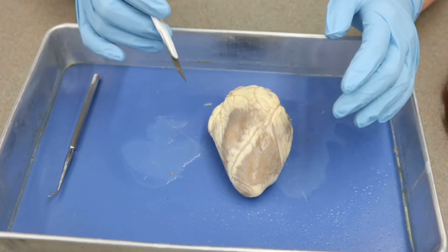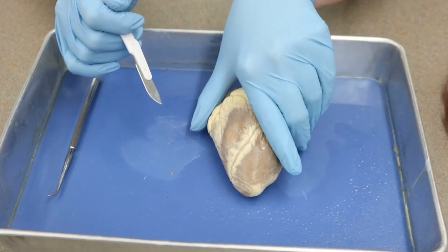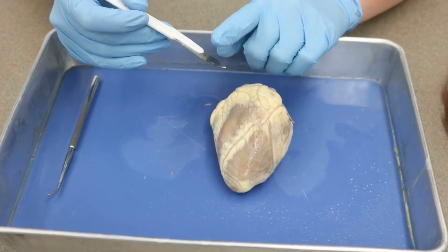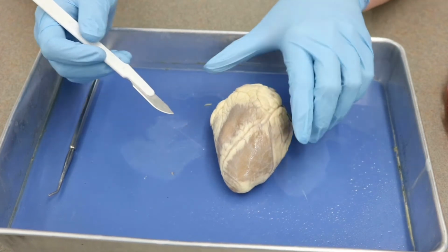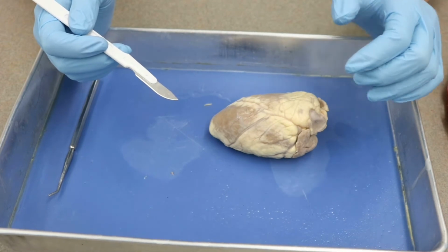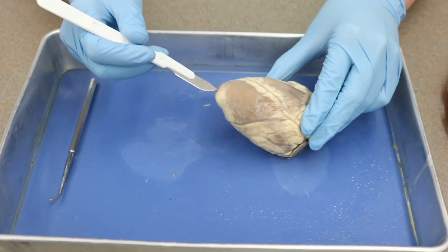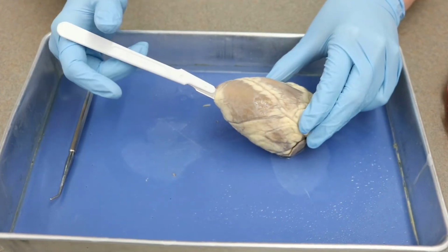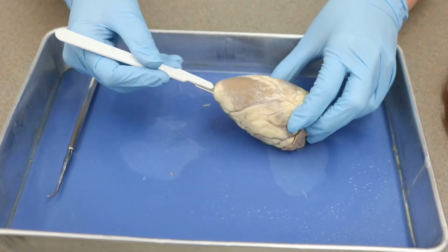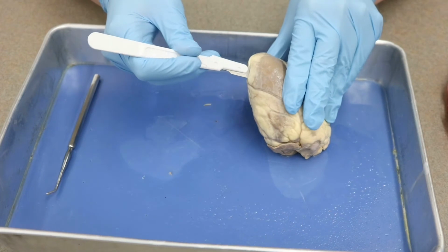All right, guys, so now we're going to look at how to actually do the dissection of the sheep heart, which is the one you should be dissecting for yourself. Just as we have mentioned before, make sure the blade is pointed away from you, okay? You're always cutting away from yourself. With the sheep heart, there's several different ways that you can do the dissection, but what we're going to do is find the apex of the heart and put your scalpel in like that, just so you're about to the end of the blade, and then you're going to slowly cut up through the left side of your heart.